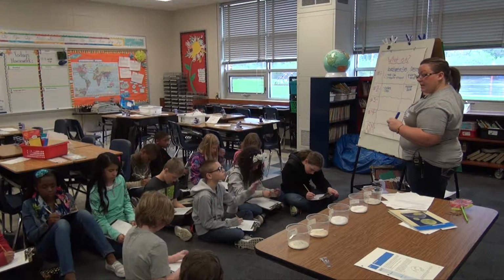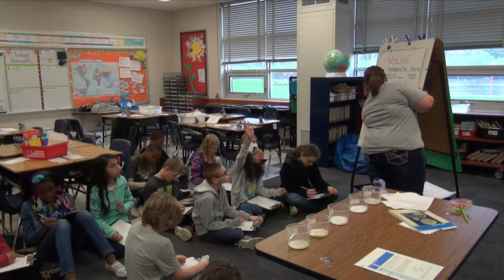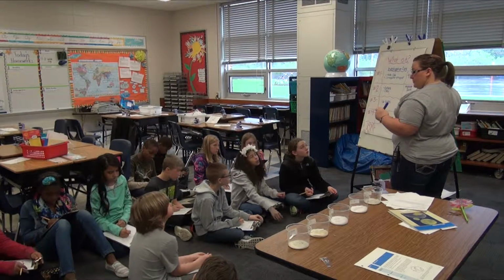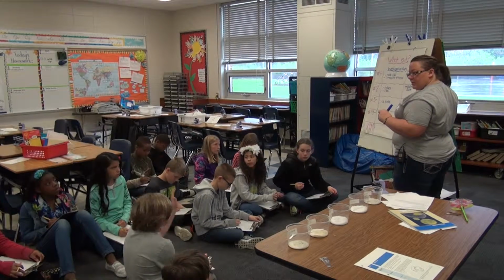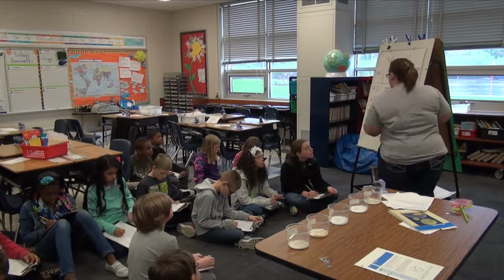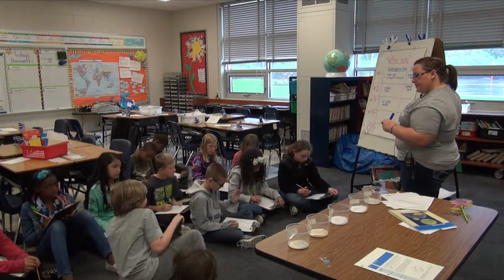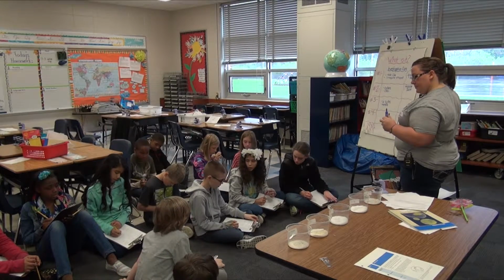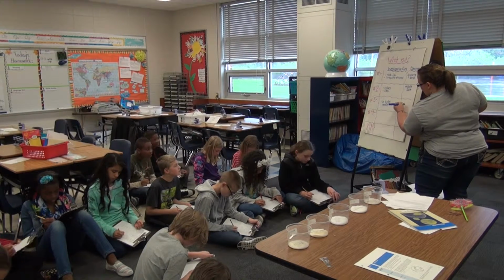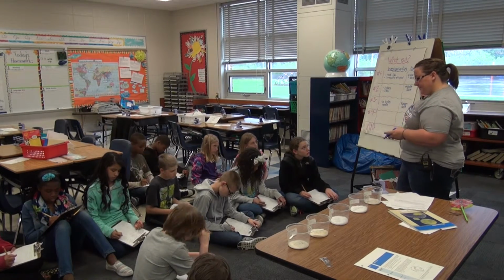Number 3. Yep. 6 sides. Okay. Had 6 sides. Some are needle shaped. Did anybody see needle shaped ones in their microscope? Okay, good. Guesses on what you think it could be? Spencer. Epsom salt. What about our last one? Number 4.